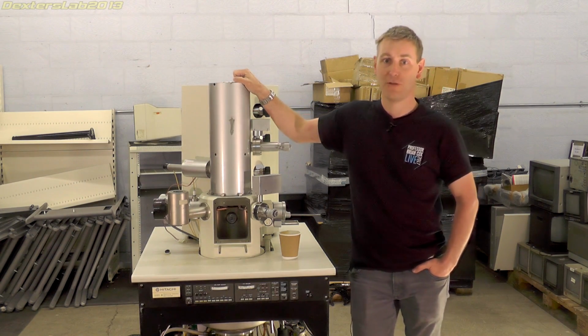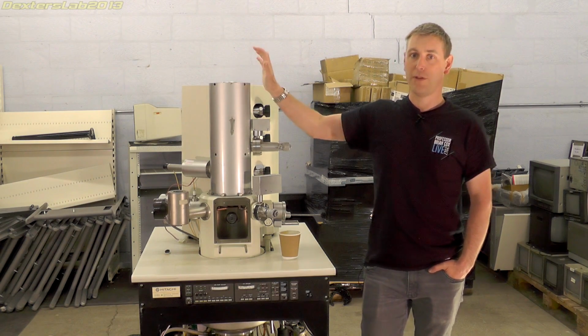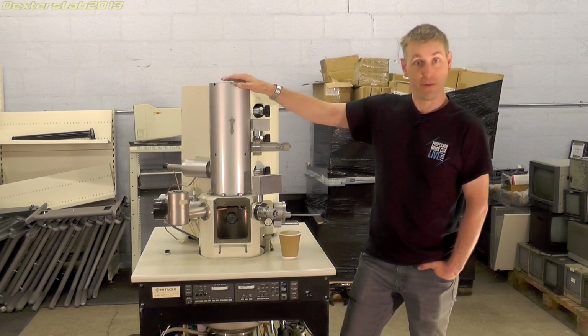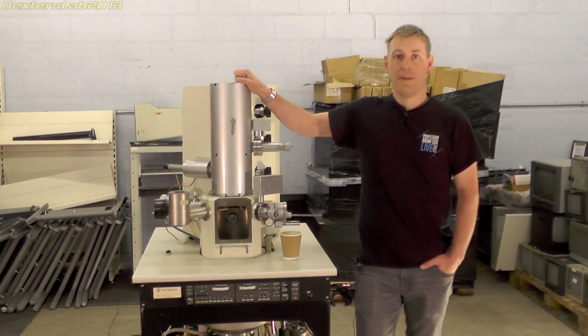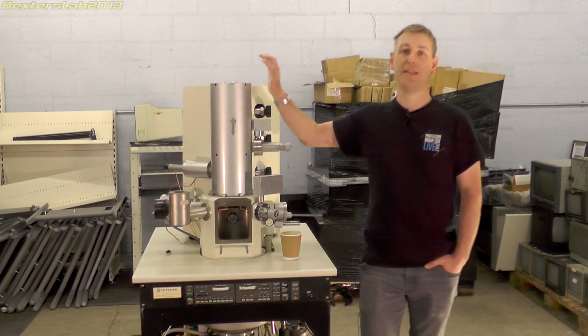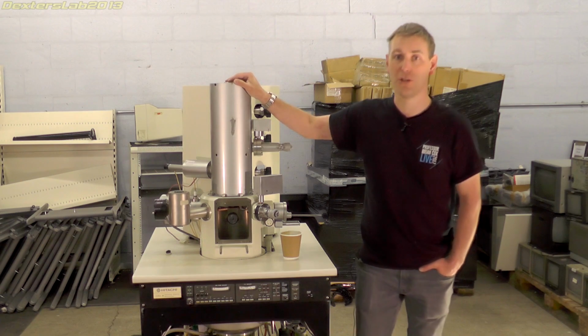This microscope has already been discussed a bit on the EEVblog forum, so I do know that a few of you already know some details about this teardown, but for those who don't, this is an S800 model SEM made by Hitachi. It dates from 1988. It's not working because it's missing quite a lot.